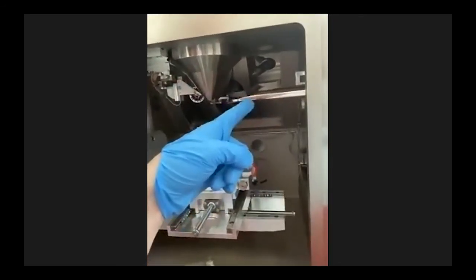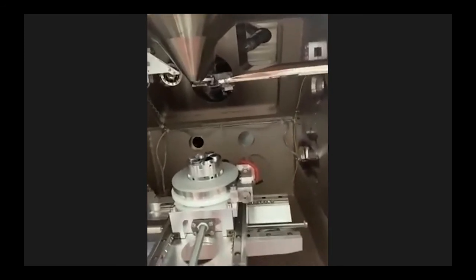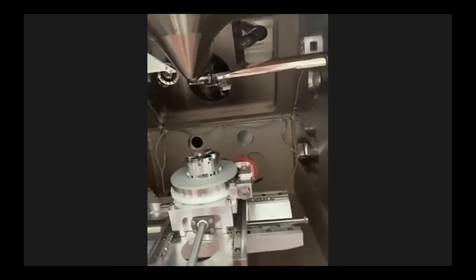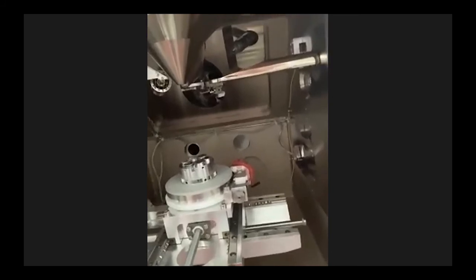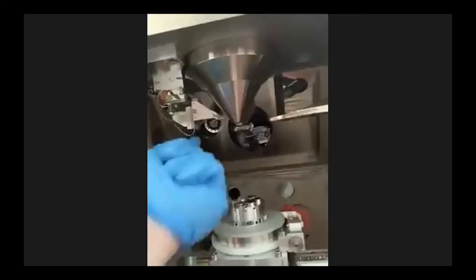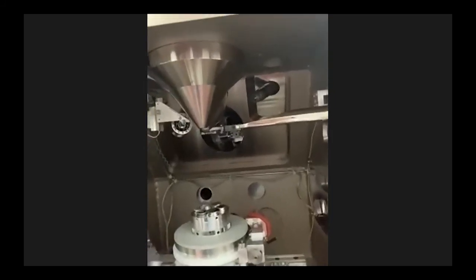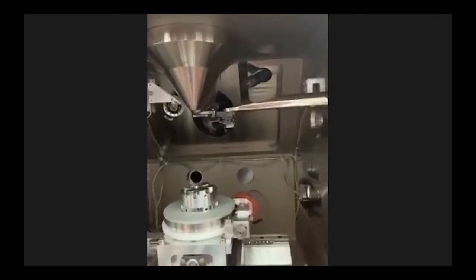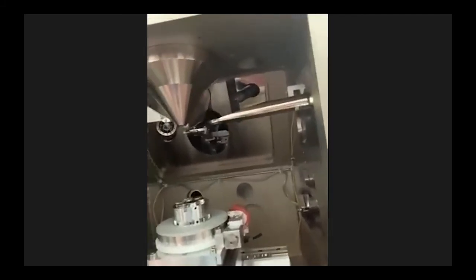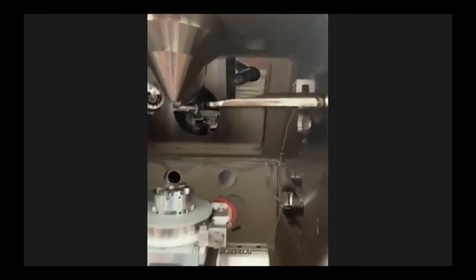From the side, it's the backscattered electron detector. You can check now in the video that I'm moving it, it's going in and back. These things over there are the secondary electron detector. And moreover, what we have here is EDX, on that part right there.